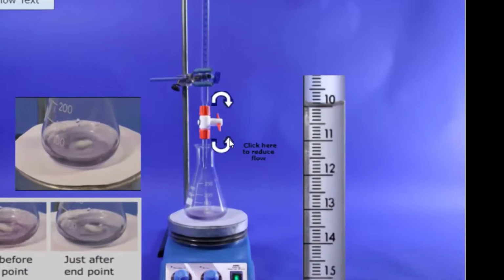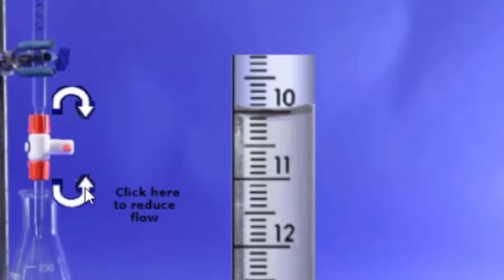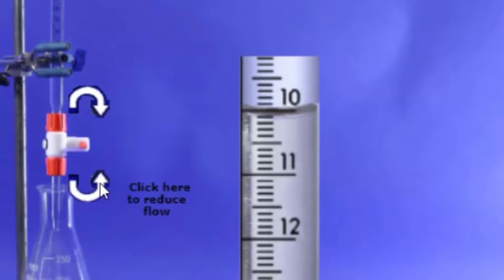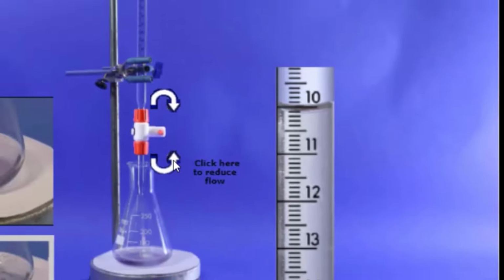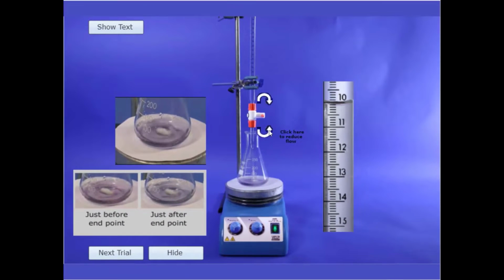For your calculations, you will need to know the total volume of the EDTA used in each titration. When you have completed a titration, you can return to the start and set up another titration by clicking on Next Trial. It is good practice to do a rough titration first to estimate the approximate volume of EDTA required, and then carry out the titration more carefully after adding EDTA very slowly as you approach the estimated endpoint.